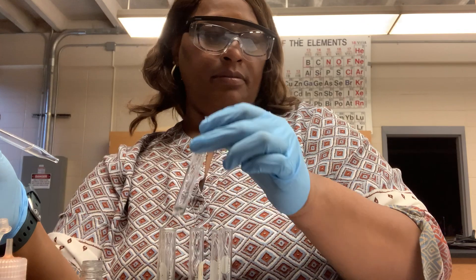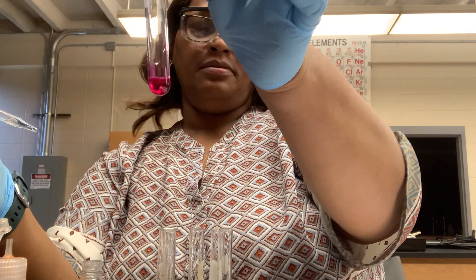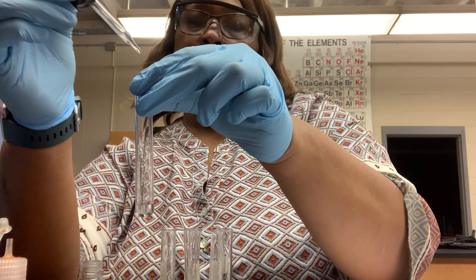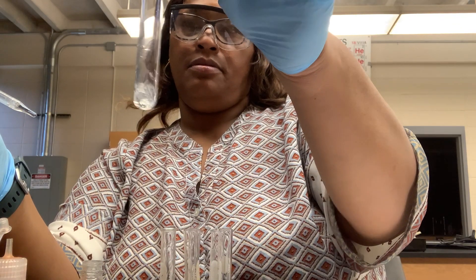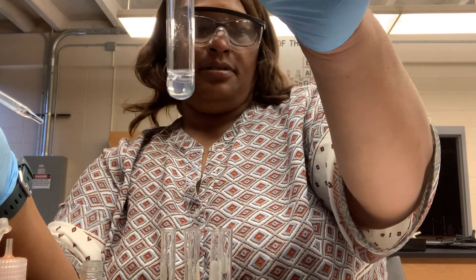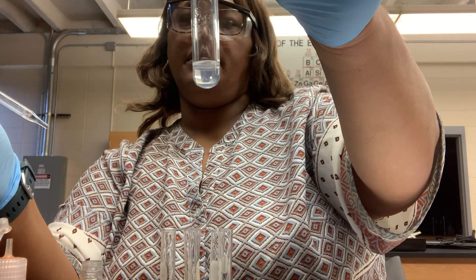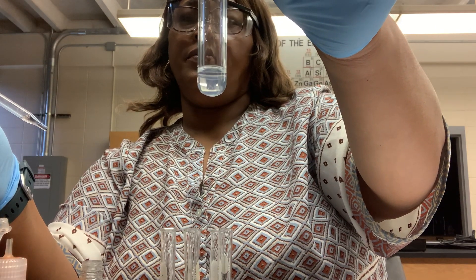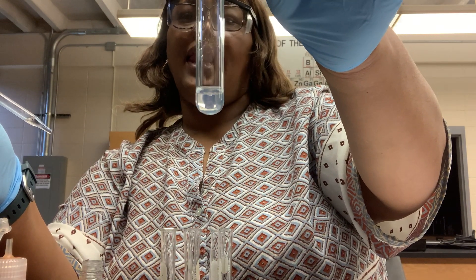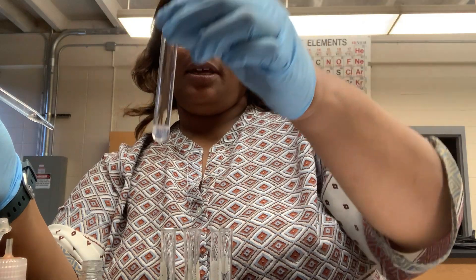Next is the ammonia with phenolphthalein, and then finally the club soda. Note to see if there's any color change — if not, it would be colorless. If you can still see through the solution, it's clear. If light is not passing through the solution, then you would say it's cloudy or opaque. But if you can see light passing through the solution, then it's clear, and if no color change, then colorless.